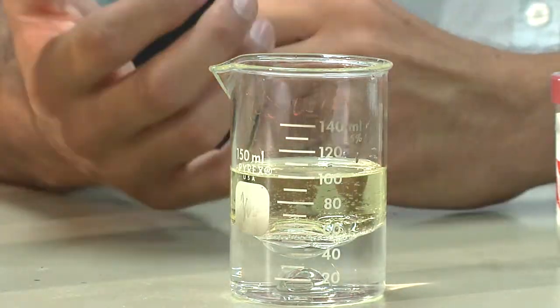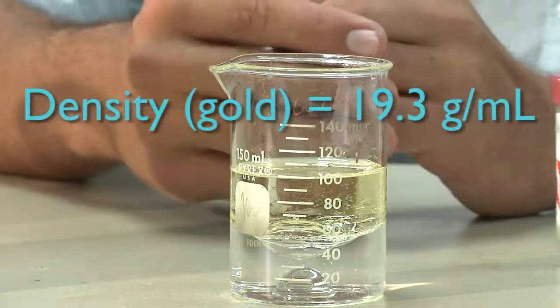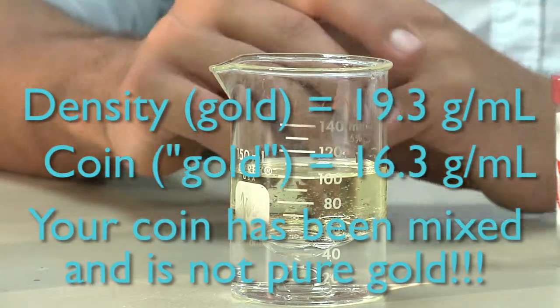Density is important because it can help identify chemicals. For example, if we know that gold has a density of 19.3 grams per milliliter, and we buy a coin and find that its density is less than 19.3 grams per milliliter, we know that this coin is not pure gold.